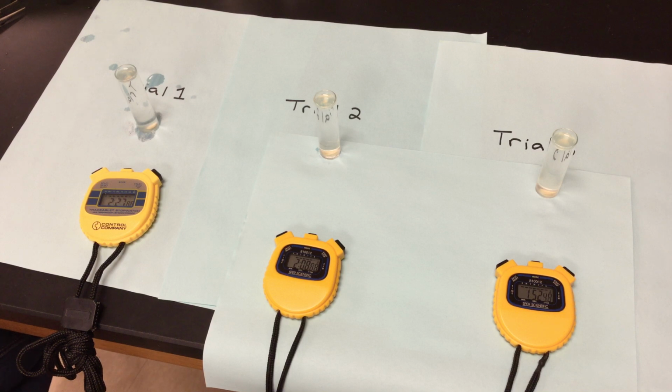So our pHs are what you are controlling. Your reaction time you cannot control, so that will vary. So think about what needs to go on the independent and dependent axis here. So we're about 2:45 on the first one, 2:25 on the second one, and a little over 2 minutes on the third one. So pH of 11 is very basic. We're not going too far with these, but we're going to give them a 4-minute time frame just to make sure.